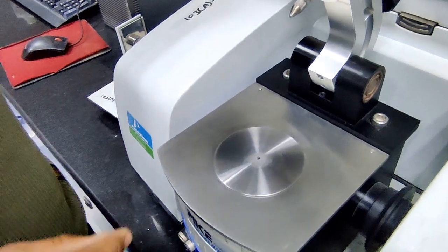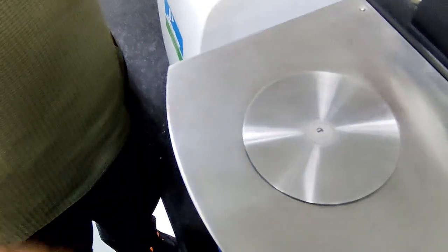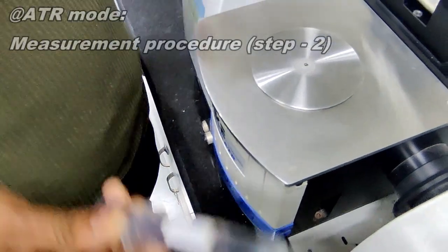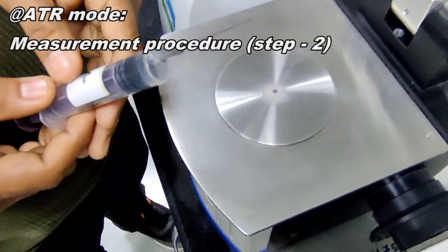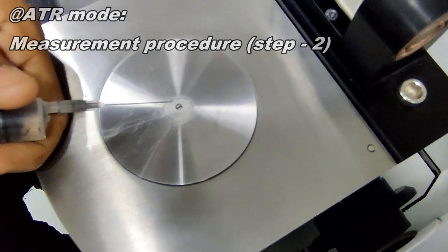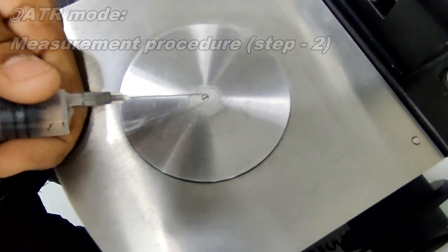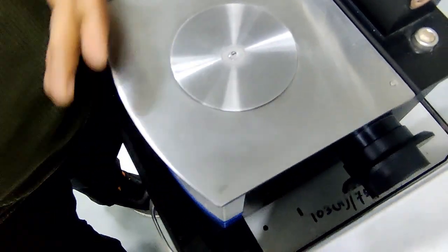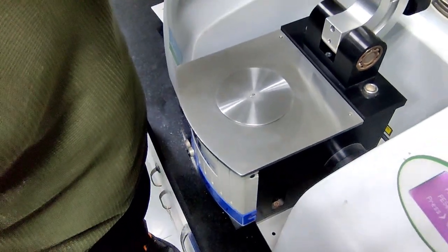We have to place the sample on this diamond crystal. Now I am giving a methanol sample. I am using a syringe for giving the methanol sample. We have to give 1 drop. Yeah, I placed the methanol.